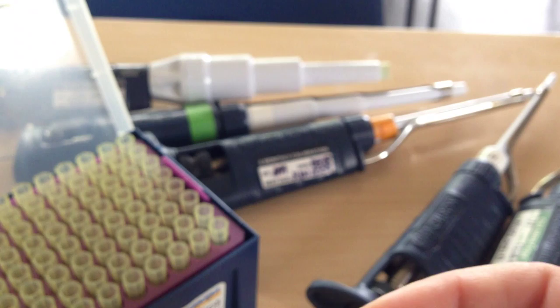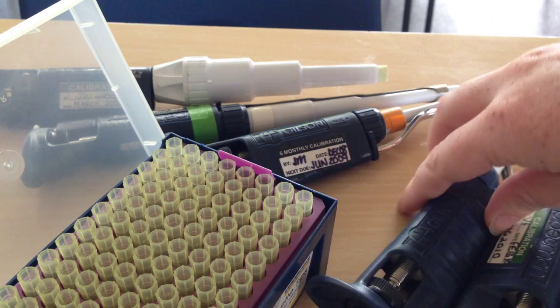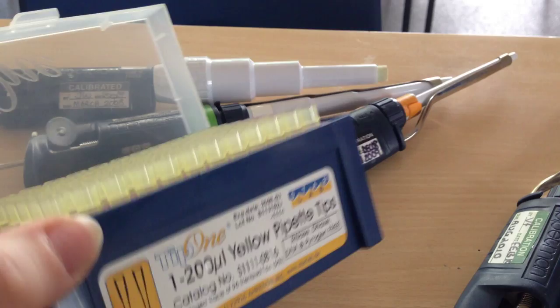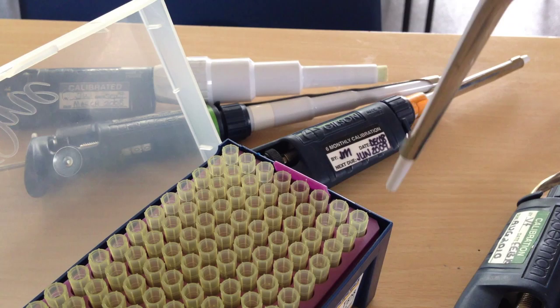So the way that you add a tip onto a Gilson is you need to pick the correct Gilson for the tip. You see these ones are actually color coded. The yellow P100, and then you can see on the front it will say from 1 to 200 microliters.